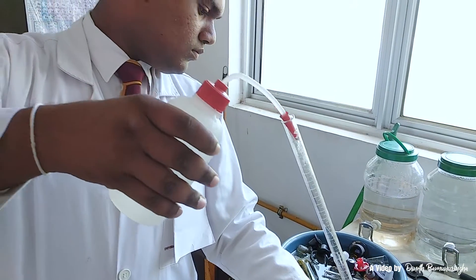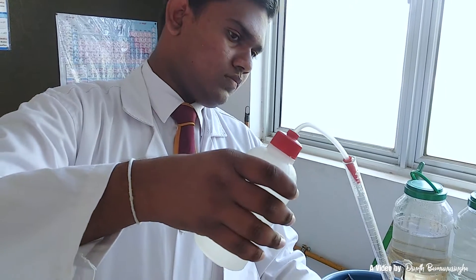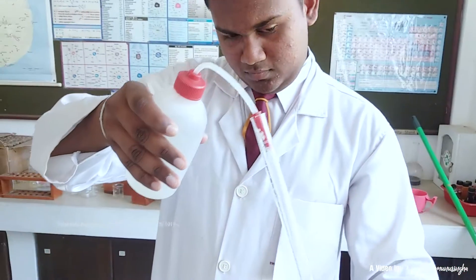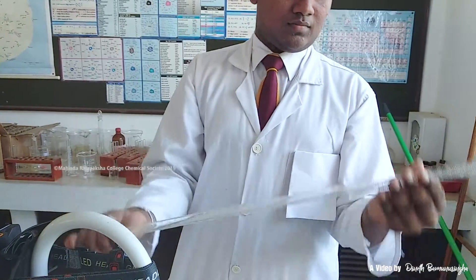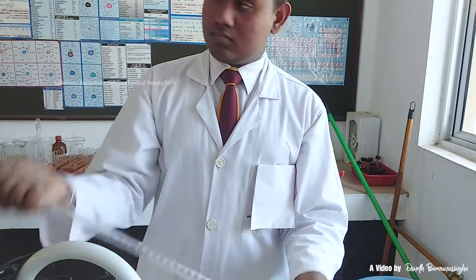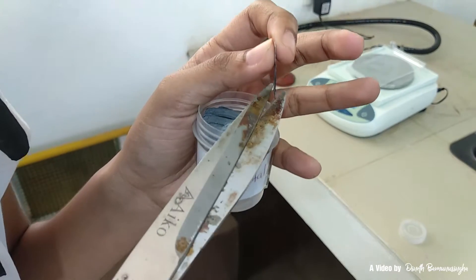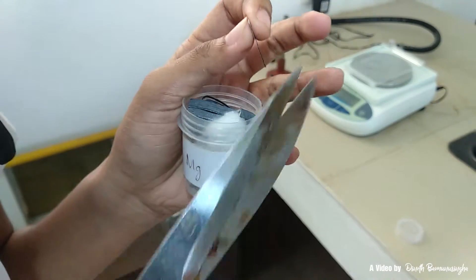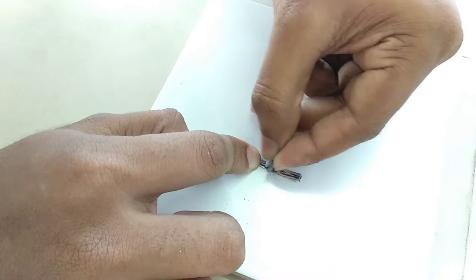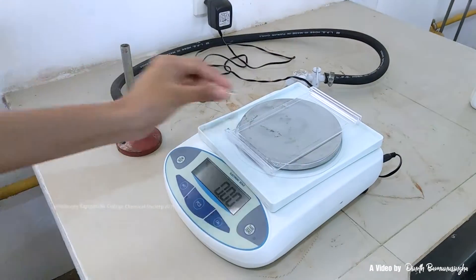Prior to the experiment, glassware is cleaned properly. First, cut a piece of magnesium strip, clean it properly to remove its oxide layer, and weigh it using the electronic scale.